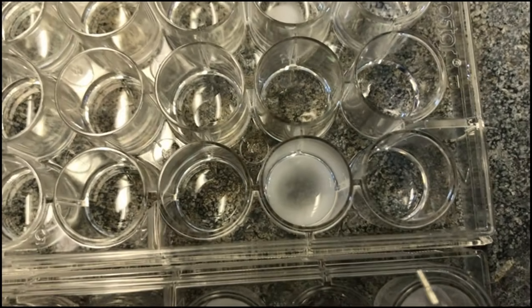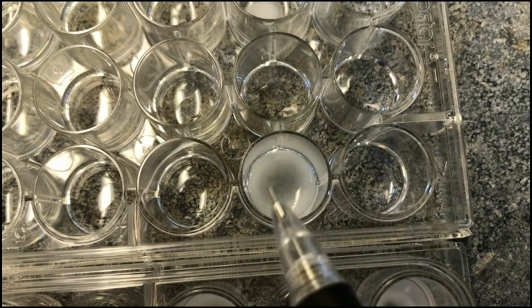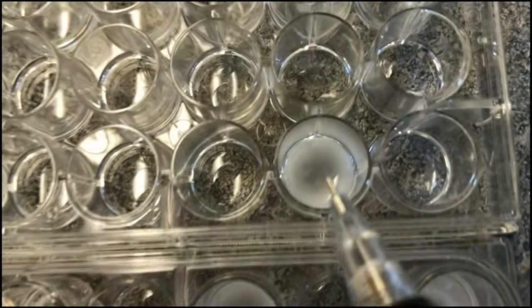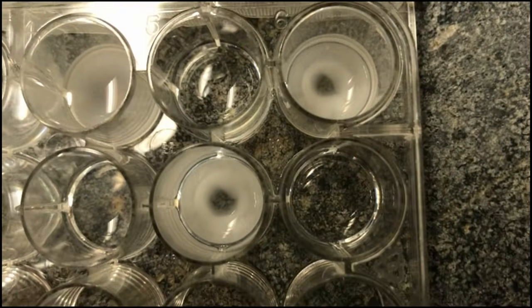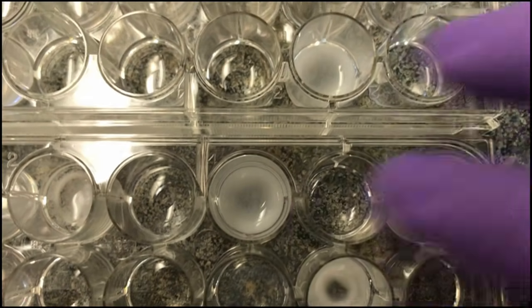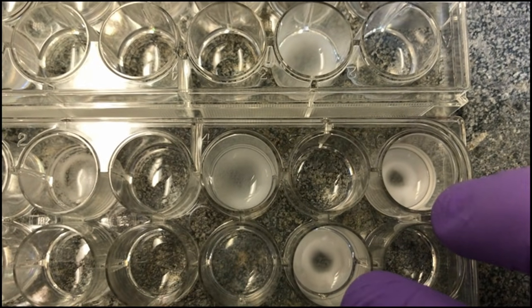4 and 5, we have a much more distinct white precipitate where you can almost see these grains. They are on the outside, as you can see. Actually, not really. Not as distinct as here. These two are definitely a separation. Yeah, these two look more milky and they're spread throughout the entire well, whereas these are larger particles that have settled on the perimeter.